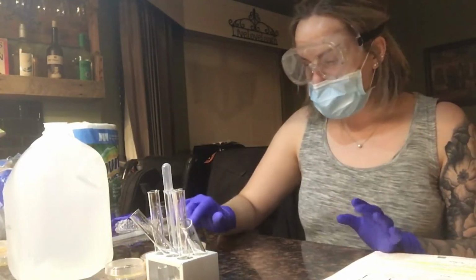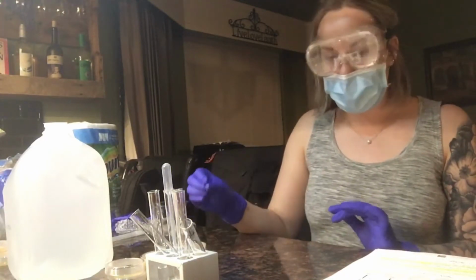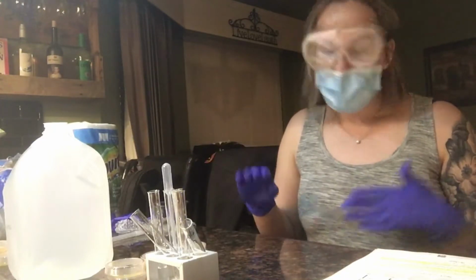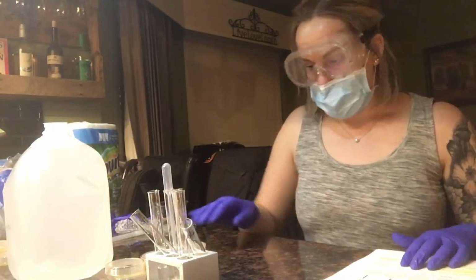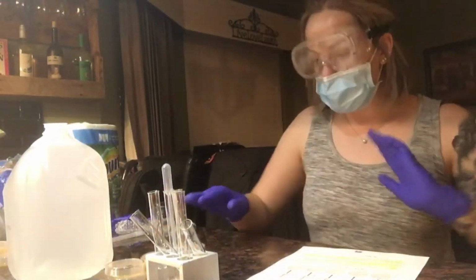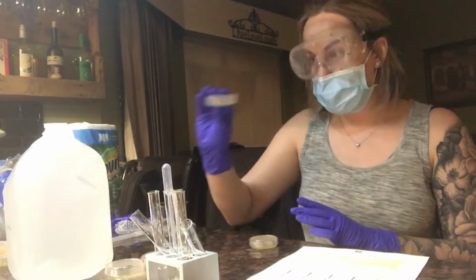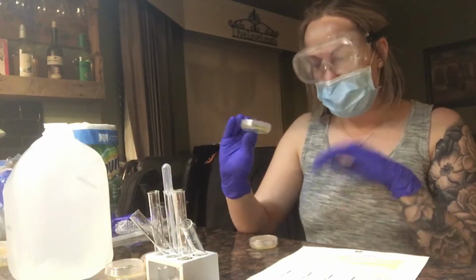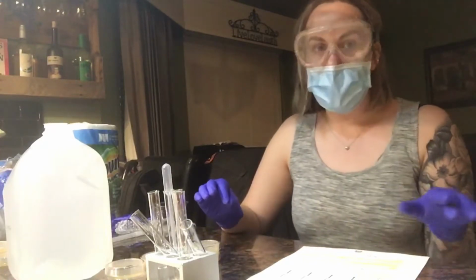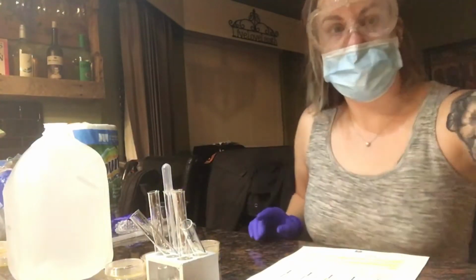Now I'm going to invert the plates. I'm going to let them sit for 12 hours. I'll go back to my incubation area and then flip them and leave them for another 36 hours. So I'll update after the 48 hours. Actually, I'm going to leave my plates lid side up for the 12 hours like this so that they can absorb, and then afterwards I'm going to invert them for 36 hours. So I don't invert and then flip. I'm going to leave them and then invert after 12 hours.